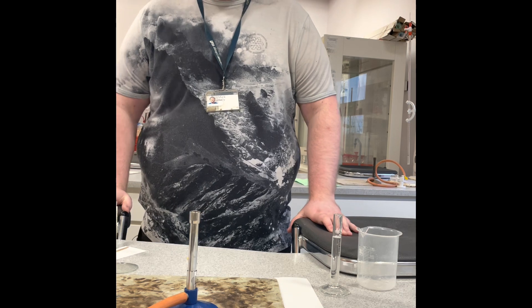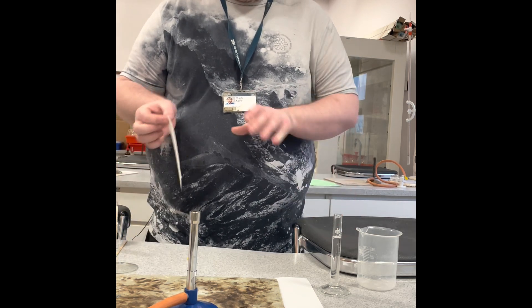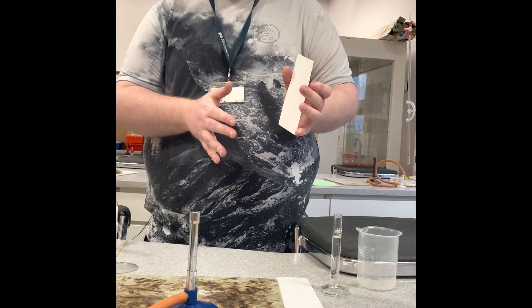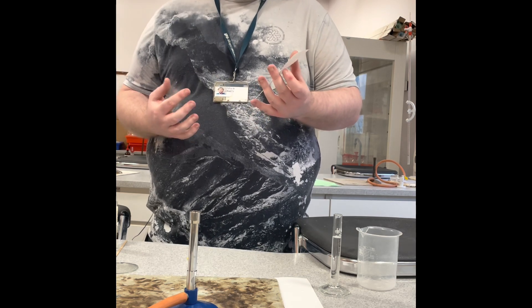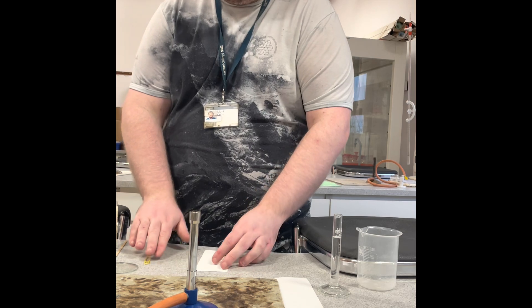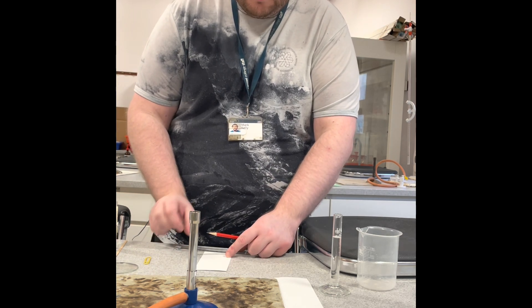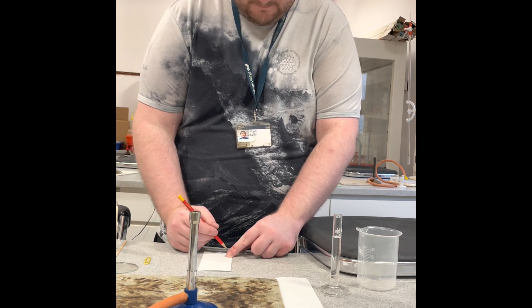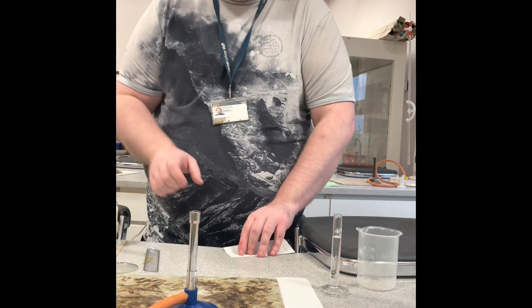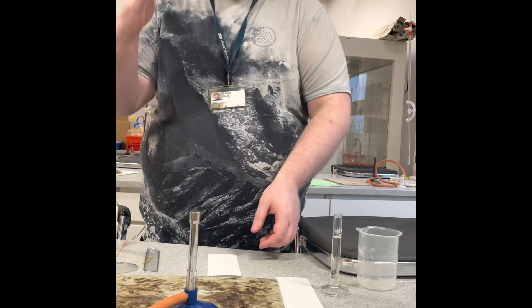First, prepare the chromatography paper. It's very important to handle it with care — do not touch the front of the paper itself. If you touch the chromatography paper, you'll get invalid results and you won't be sure whether what appears is the amino acid you're testing for or your own fingerprint. Using your pencil and ruler, draw a line about one centimetre from the bottom.